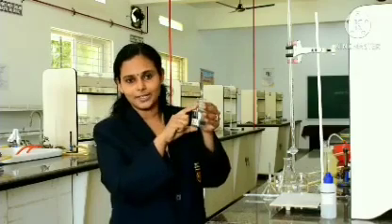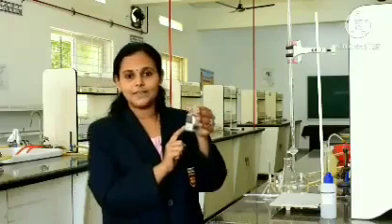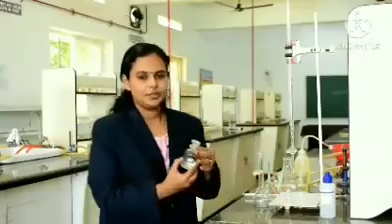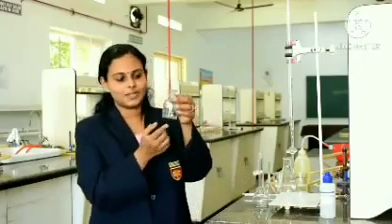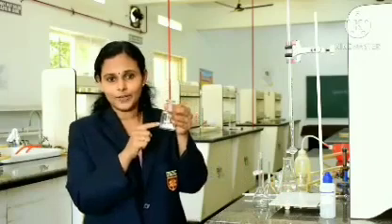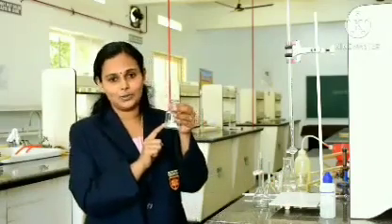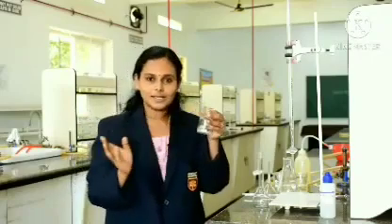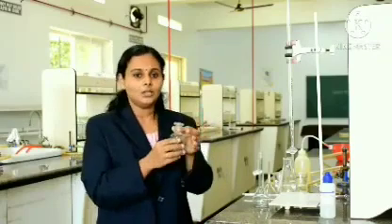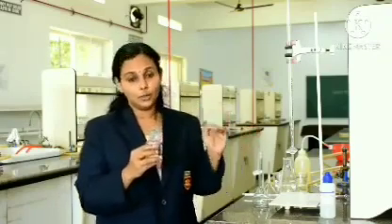This is a small reagent bottle, and the solution to be analyzed is given in this reagent bottle. This is the sodium hydroxide solution given to us to estimate. That is, we are going to find out the amount of sodium hydroxide present in this solution. Now, the mass is unknown to us as well as the volume. We do not know the volume of the solution. So, first our step is to convert it to a known volume.